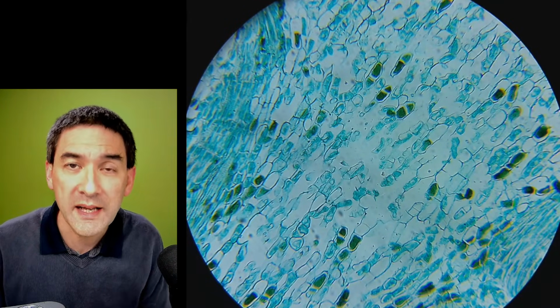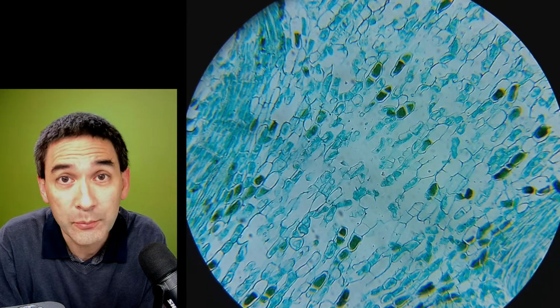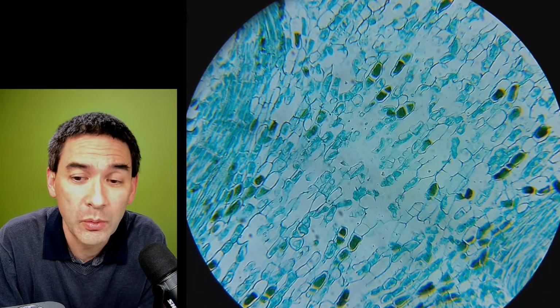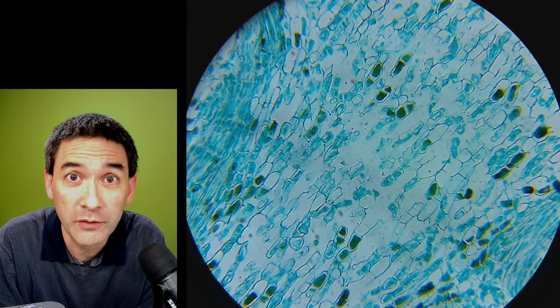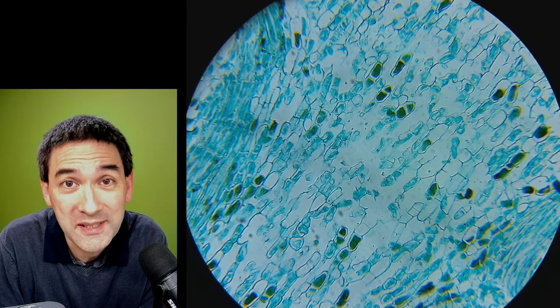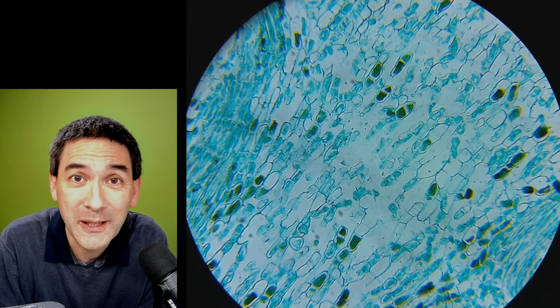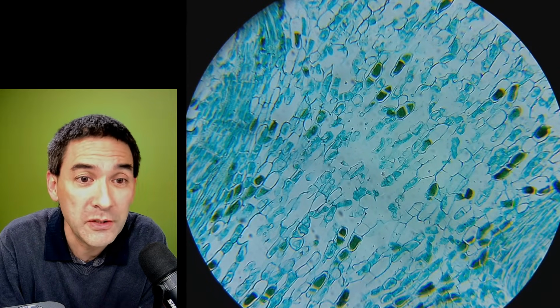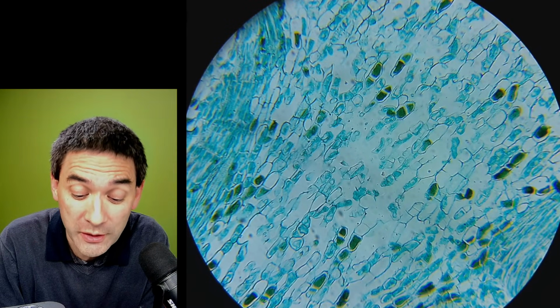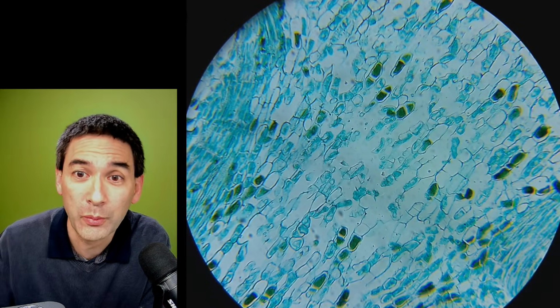There was a request last week if I could talk a little bit about connecting cameras to microscopes, and sure, but that's a big topic. So I thought I'm just going to show you all of my mobile phone adapters that I have. And then later on, maybe in the second part, we're just going to look at a couple of prepared microscope slides. And today I'll be using not my big, nice microscope, but the cheap one, an introductory microscope, and it actually also works quite well.